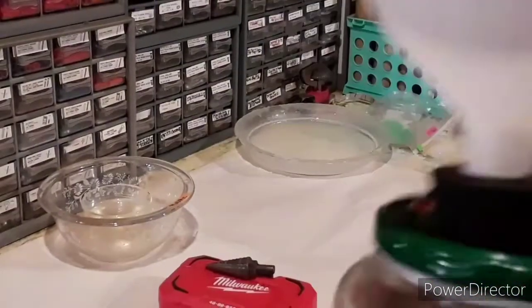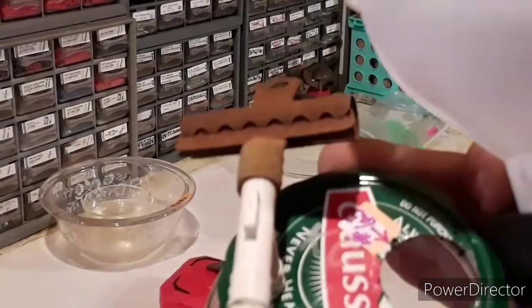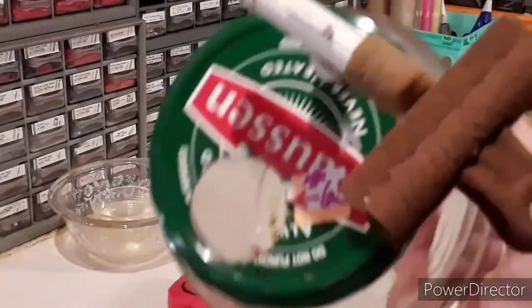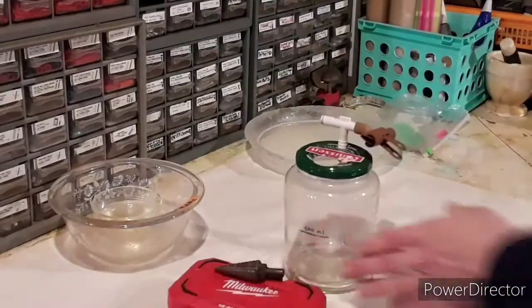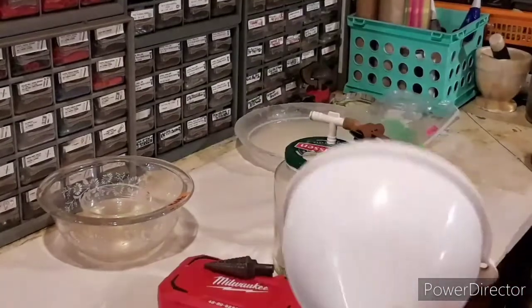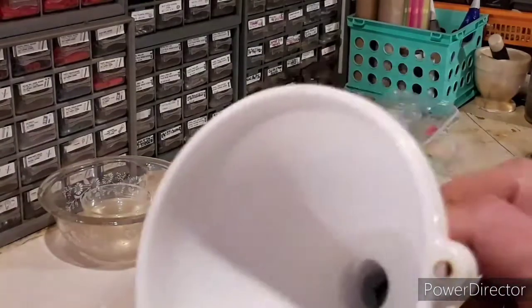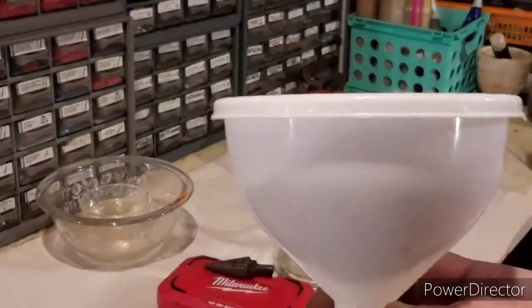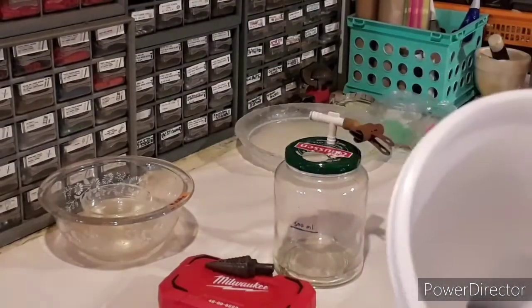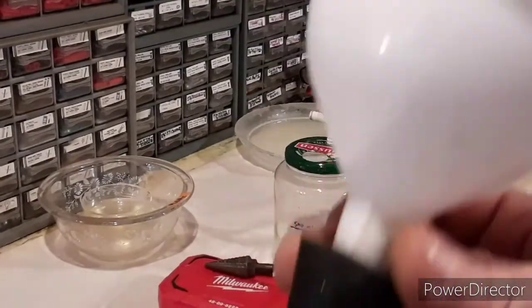I made it so that this is a number six and a half rubber stopper here. As you can see, I wrote it on there just so I know what it is. You can remove the funnel from the stopper and put any other funnel you want in this — if you've got a traditional Buchner funnel, you can stick that right in here. As long as it fits in the bore of the cork, you're unlimited.